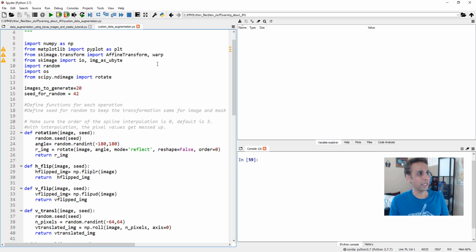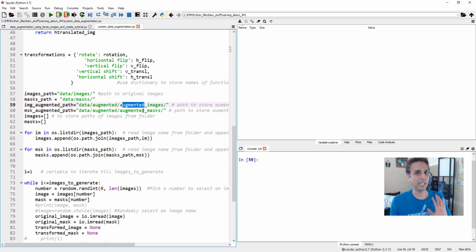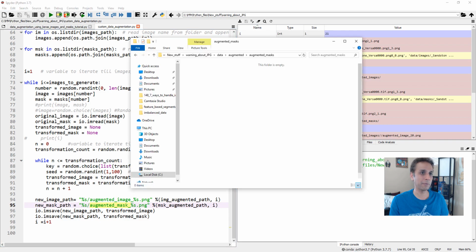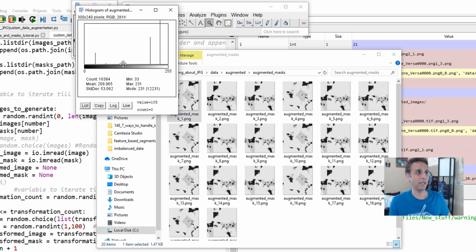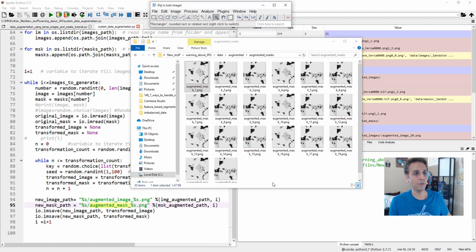So let's do one exercise. Let's generate 20 images and masks, read from this folder. Again, this is not the point I'm trying to make in this tutorial. What I'm trying to make is that I'm saving the images and masks as PNG first. So let's save them. I should see a bunch of images in my augmented folder. Now let's open one of these augmented images. This is not the original mask anymore. If I look at the histogram, it looks exactly the same. You see, it should have pixel values of 33, 65, and I can go down and show you the other two. Everything looks clean. Great.